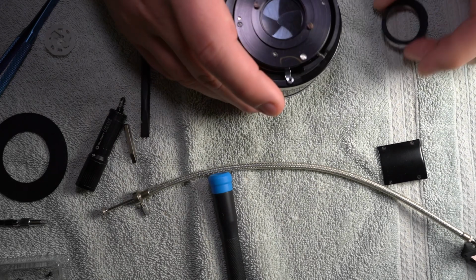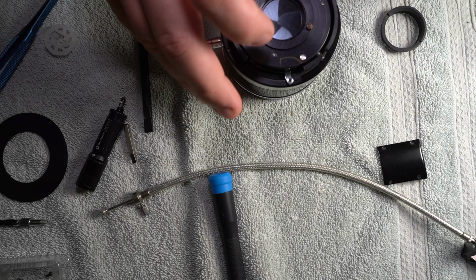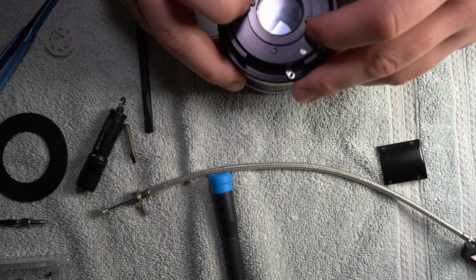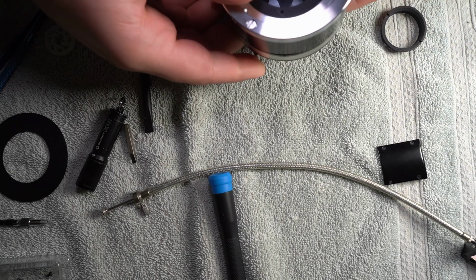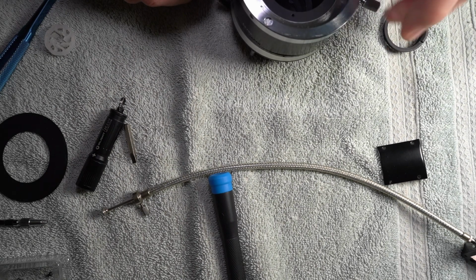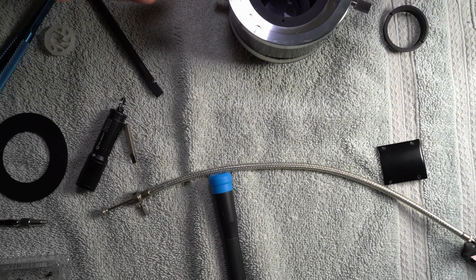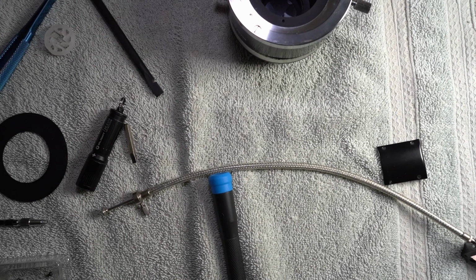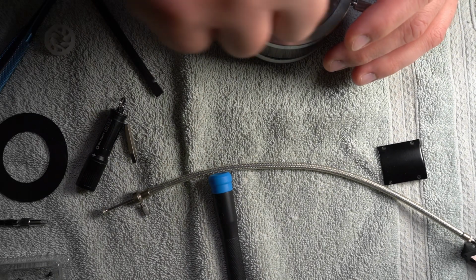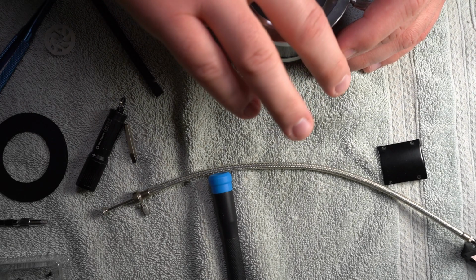And part of my problem with this is I was moving around between cameras, and there's a method to fire this that you use for an SLR film camera, and then there's a separate method that you use for a mirrorless camera or a DSLR in live view mode.